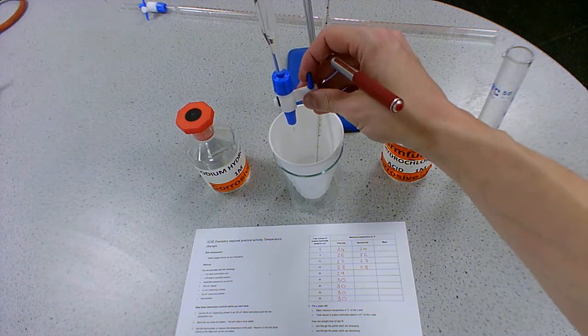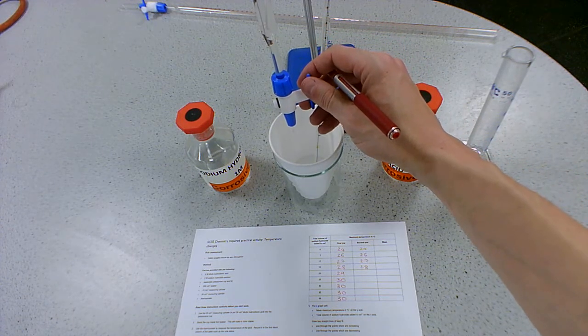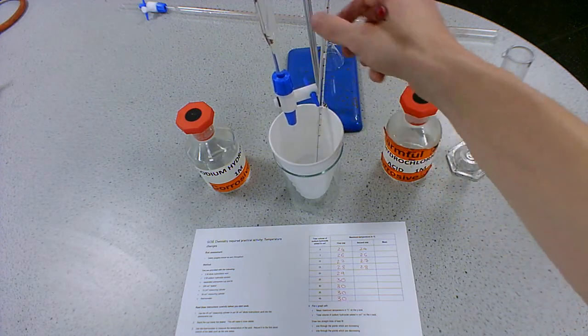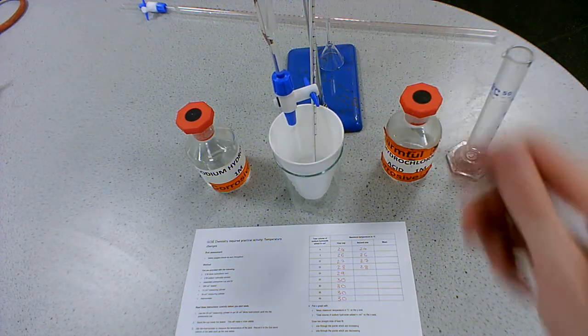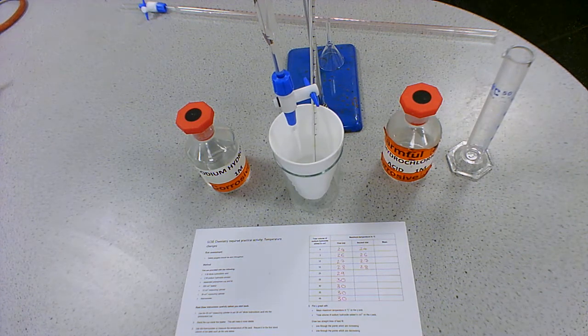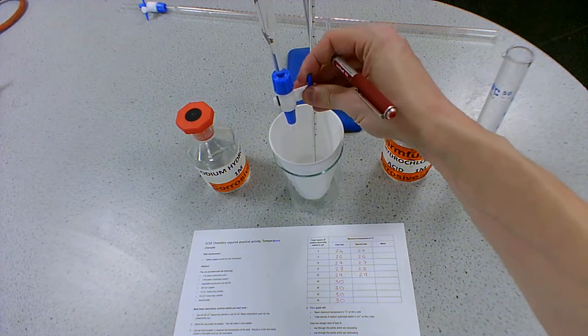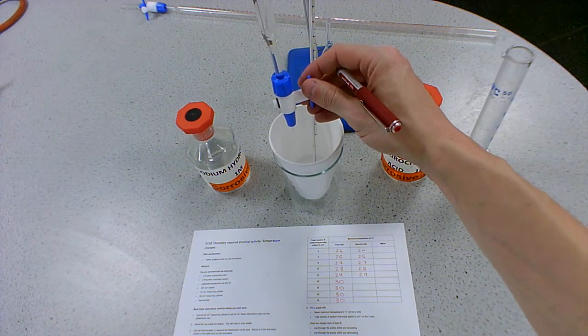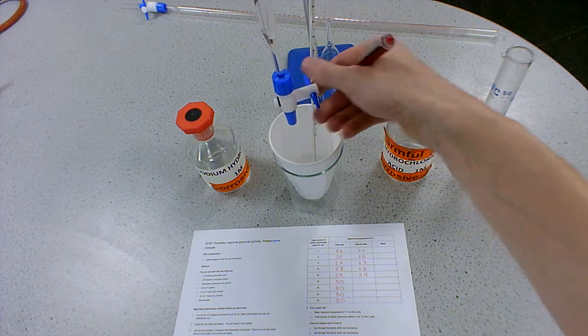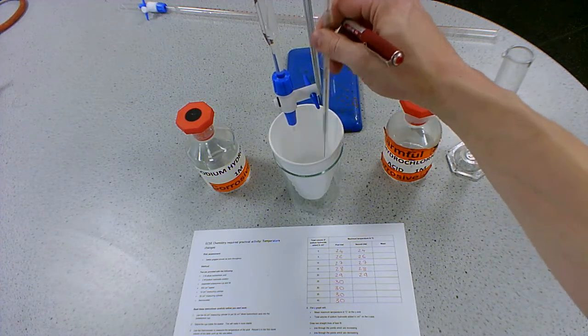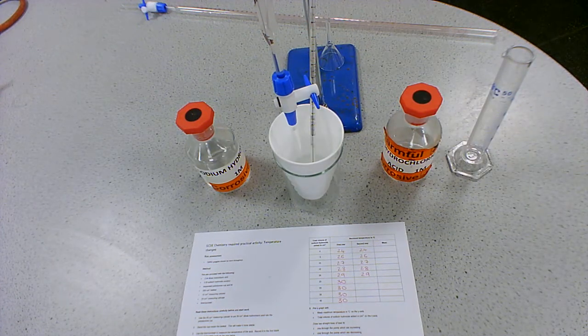Add another five. Twenty-eight. Twenty-nine. Add another five. And another five. Thirty.